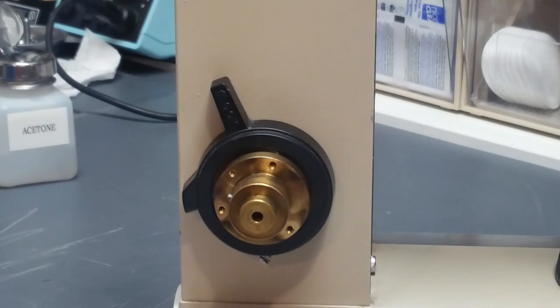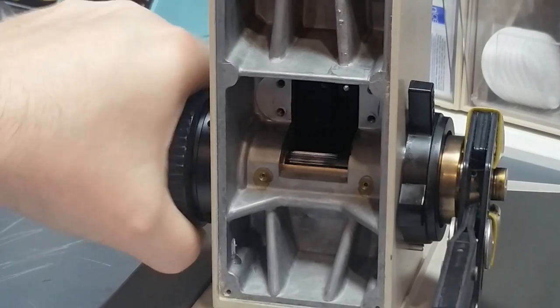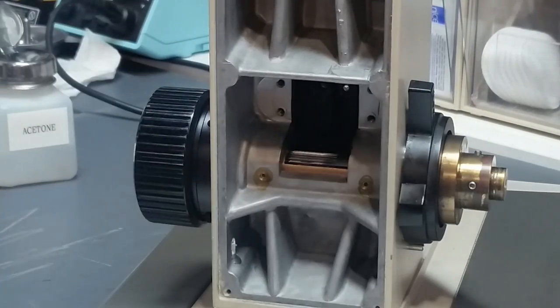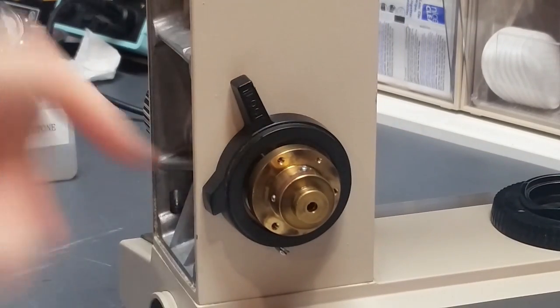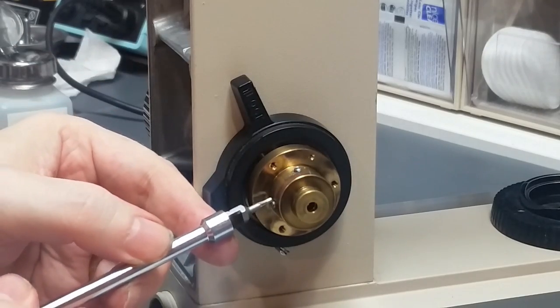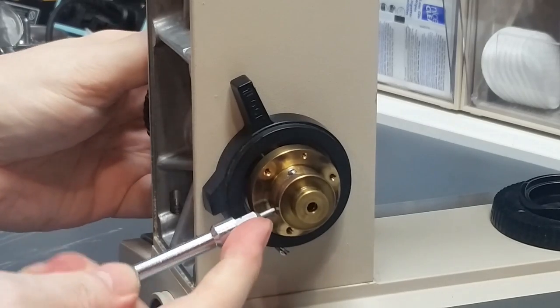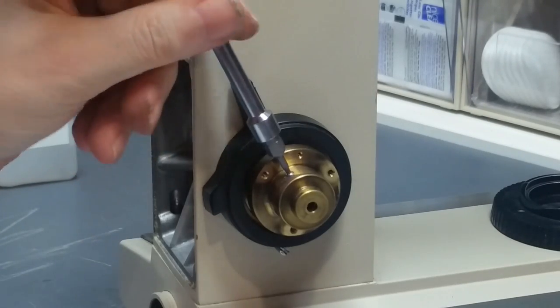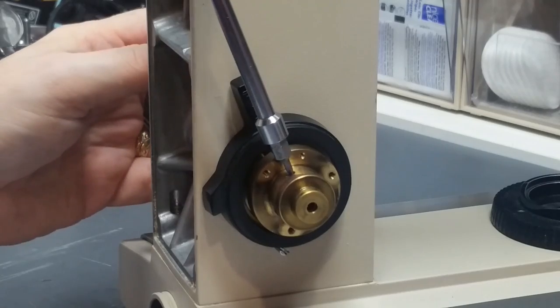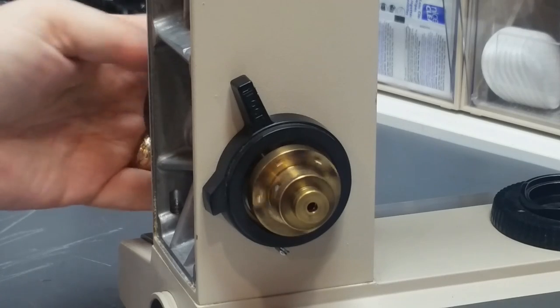What I want to do now is turn this guy around. I want to grab this thing with pliers and just snug it up a little bit. Not horribly snug, but just a little bit. Okay. So, in theory now, that's in. The spring is preloaded. It's ready to go. I just need to tighten down these two set screws to hold it all in place. There's one. There's two. So that baby's in. Nice smooth rotation. It hits the pin.